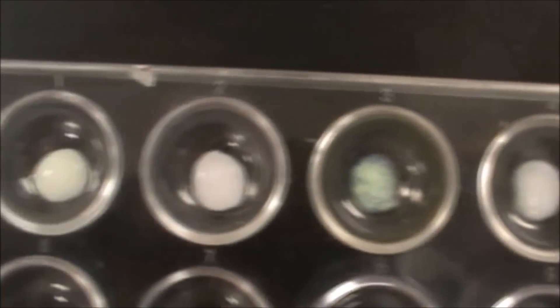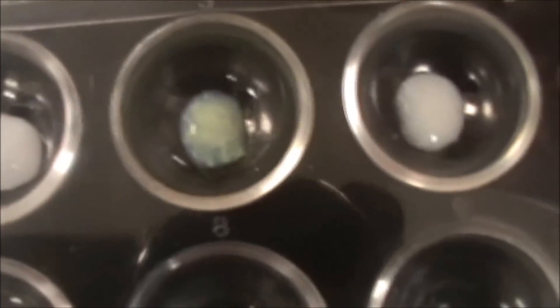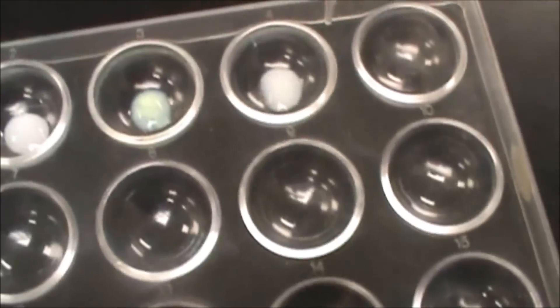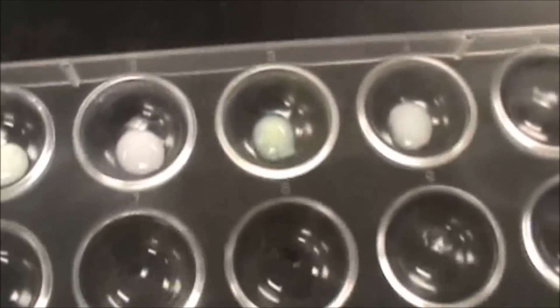So here are my different precipitates. Right now my unknown looks a little bit similar to these two. So this one's actually a little bit of a yellowish color. This one is clearly different for the iodide, so it's definitely not an iodide.